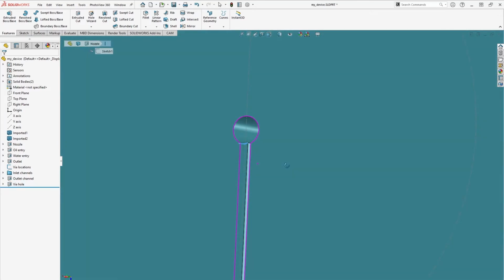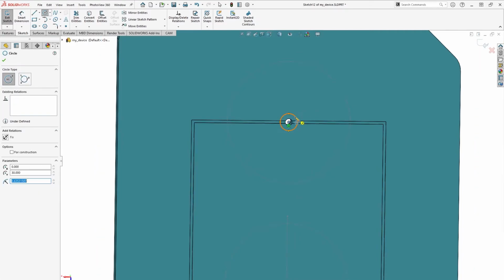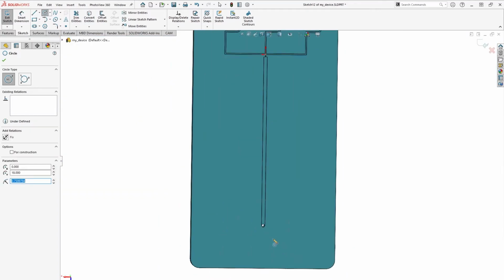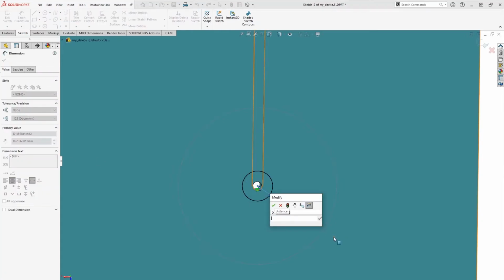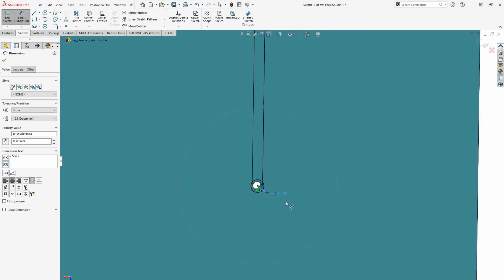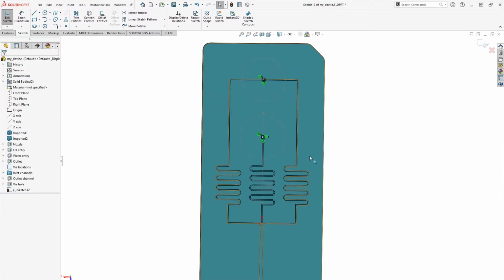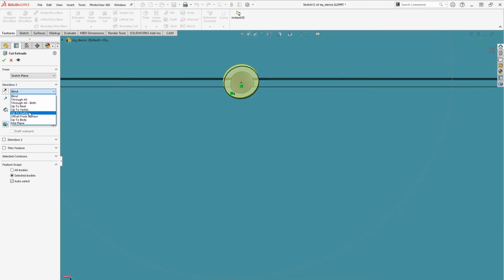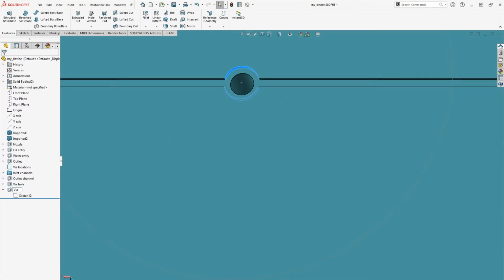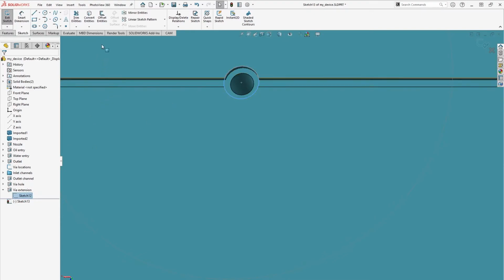Let's create another sketch with circles centered on each via hole. Then select one of the circles and add a dimension of 125 microns between it and its respective via hole. We'll then extrude cut this feature down to the channel surface and name it via extension. Create a new sketch, but this time, let's put the sketch plane on the channel surface. Then select the sketch from the via extension feature and click Convert Entities to capture the same geometry.